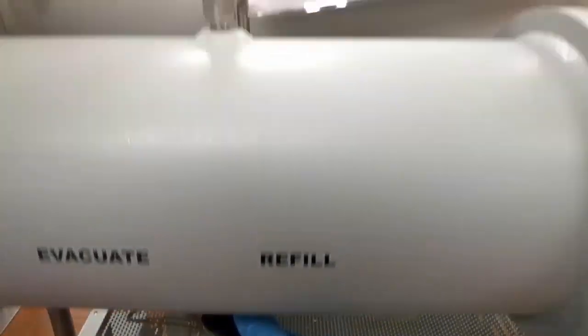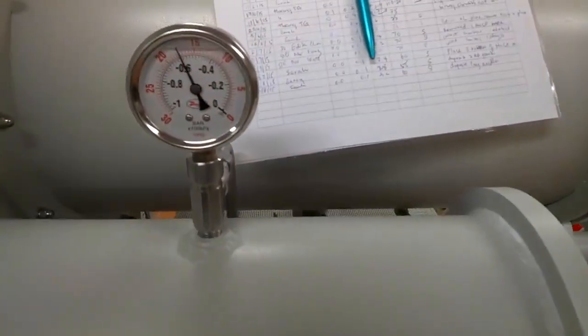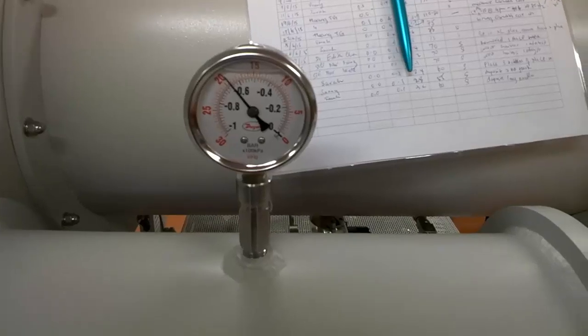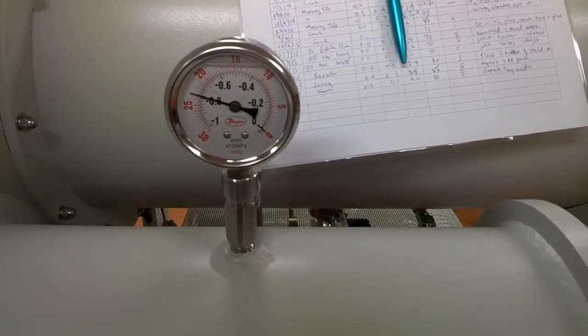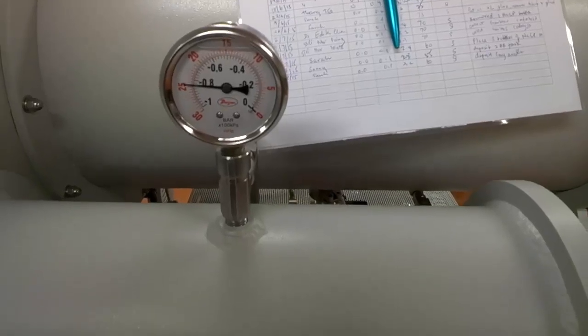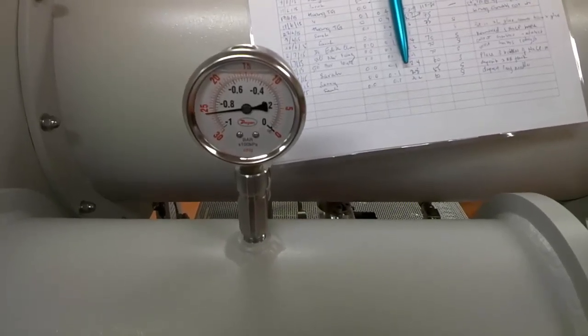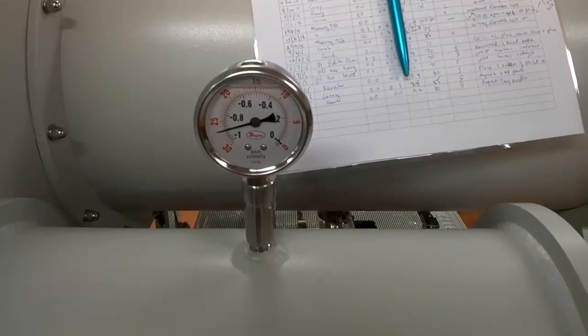You have to perform this step very carefully, not too fast because if you have an influx of nitrogen gas suddenly, it may blow away your equipment, topple them over and causing spillage inside the antechamber. So, once the needle goes to zero inches of mercury, you can rotate the valve again towards the left-hand side to evacuate the whole antechamber. This is because with one flush, with one vacuum suction, just one flush, we can't be sure if the whole antechamber is all cleansed of moisture or contaminated substances. So, we have to repeat this step three times.